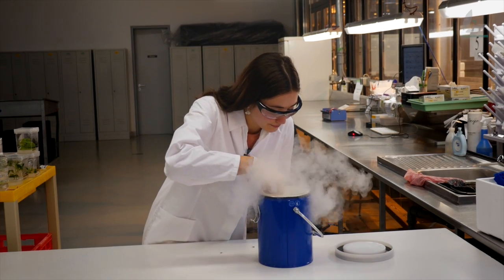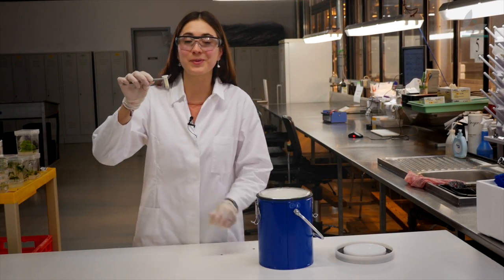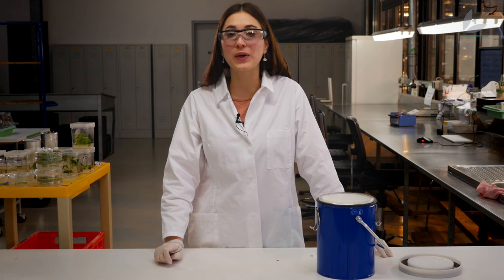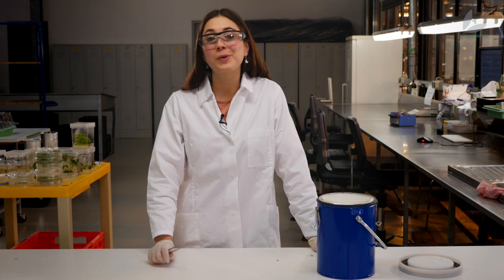So with this plant powder starts my work in the lab. First I want to analyze the DNA to see if my gene is exactly inside. Secondly, I want to find out if my gene is really active, so I will analyze the RNA and the proteins. My hypothesis was that my gene can improve photosynthesis, and that's why I have to analyze the photosynthetic activity of the plant. I really hope it worked.